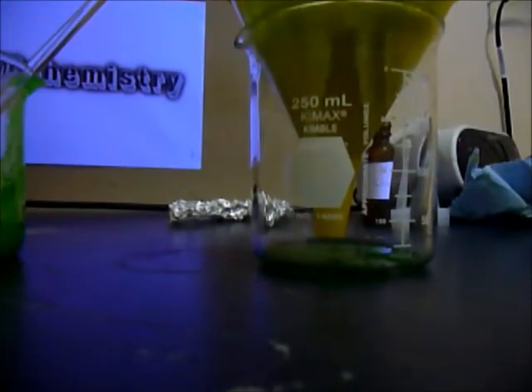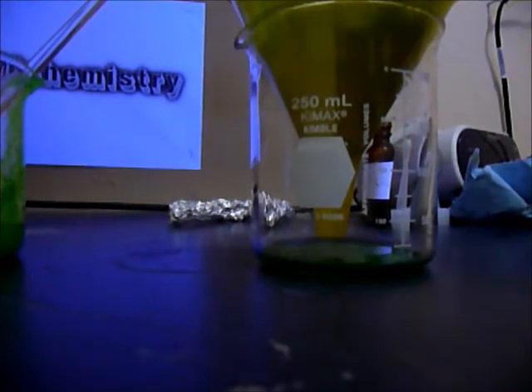Okay, and you can see it turned all green right there. So now I'm just waiting when I finish filtering. I'll show you when that's finished.